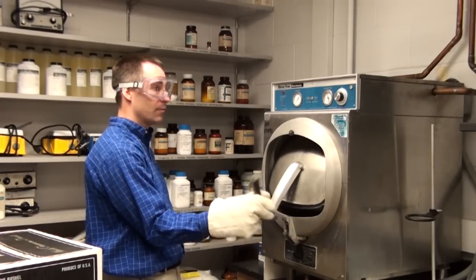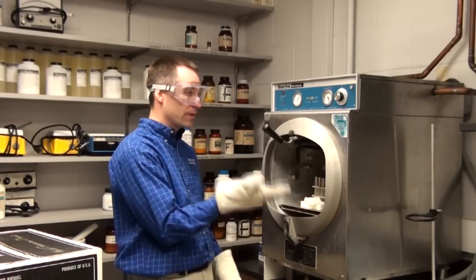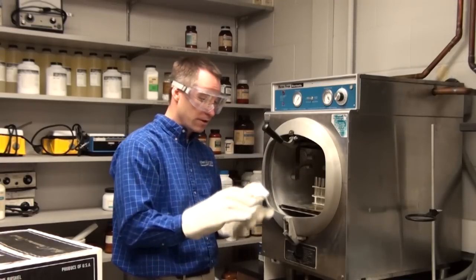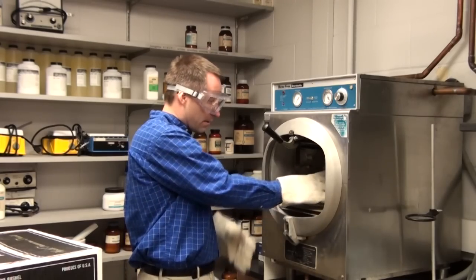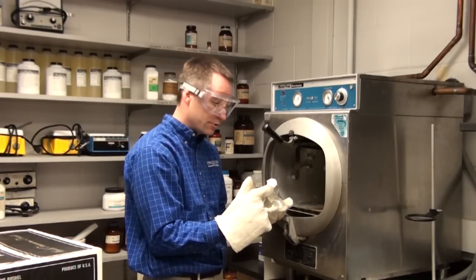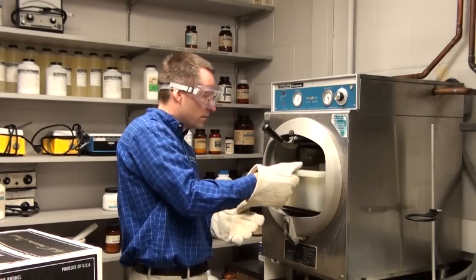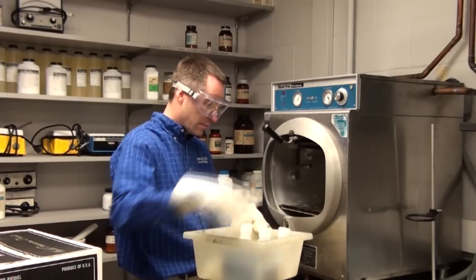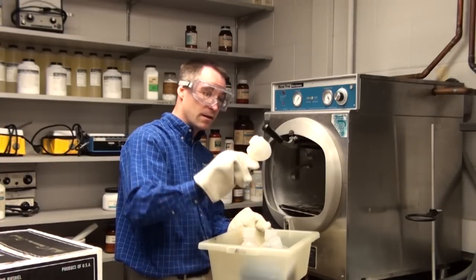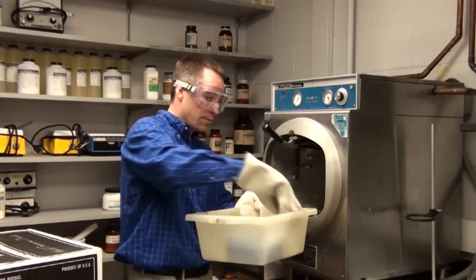Notice the steam coming out — I'm wearing appropriate equipment and keeping my face and arms away. The first thing you'll notice is that polystyrene is not autoclavable: that big polystyrene piece is now a little miniature. My autoclave tape has changed, indicating it reached at least 121 degrees Celsius. Now pulling out my secondary equipment — the polyethylene is not autoclavable either; what used to be a squirt bottle is no longer a squirt bottle. That is autoclaving in action.